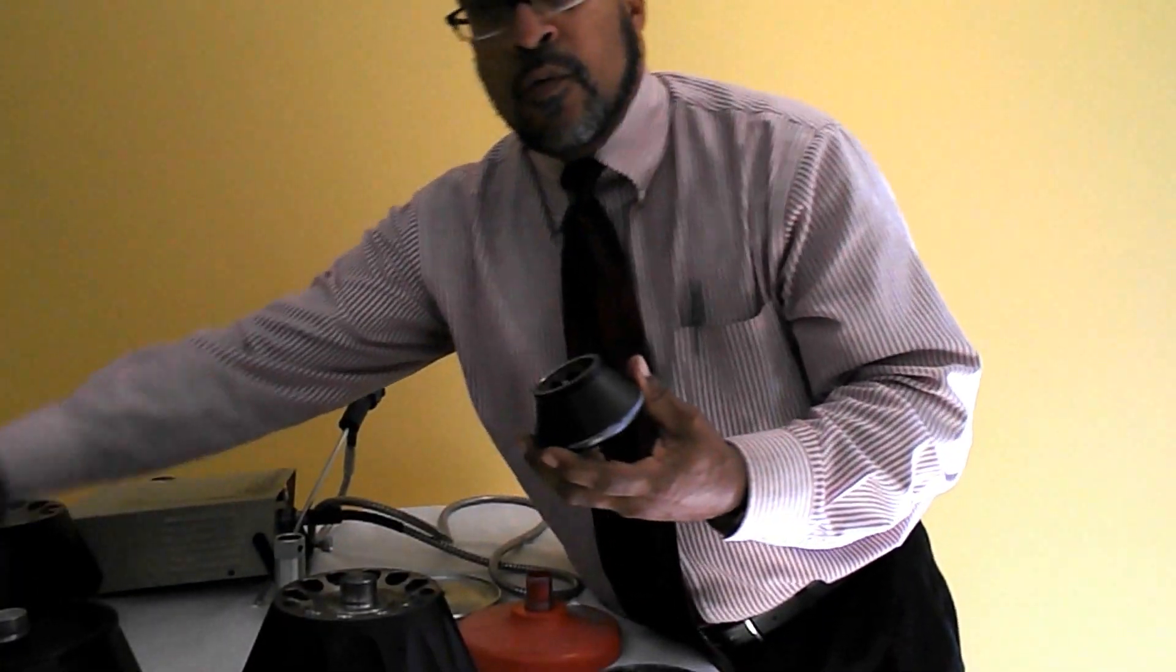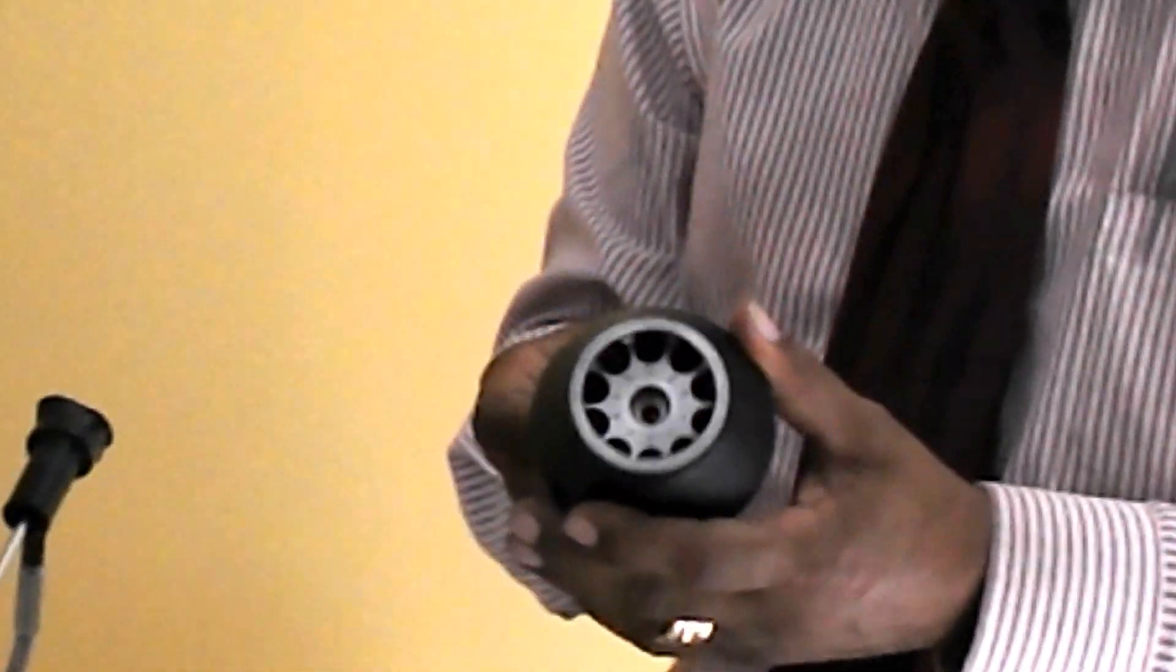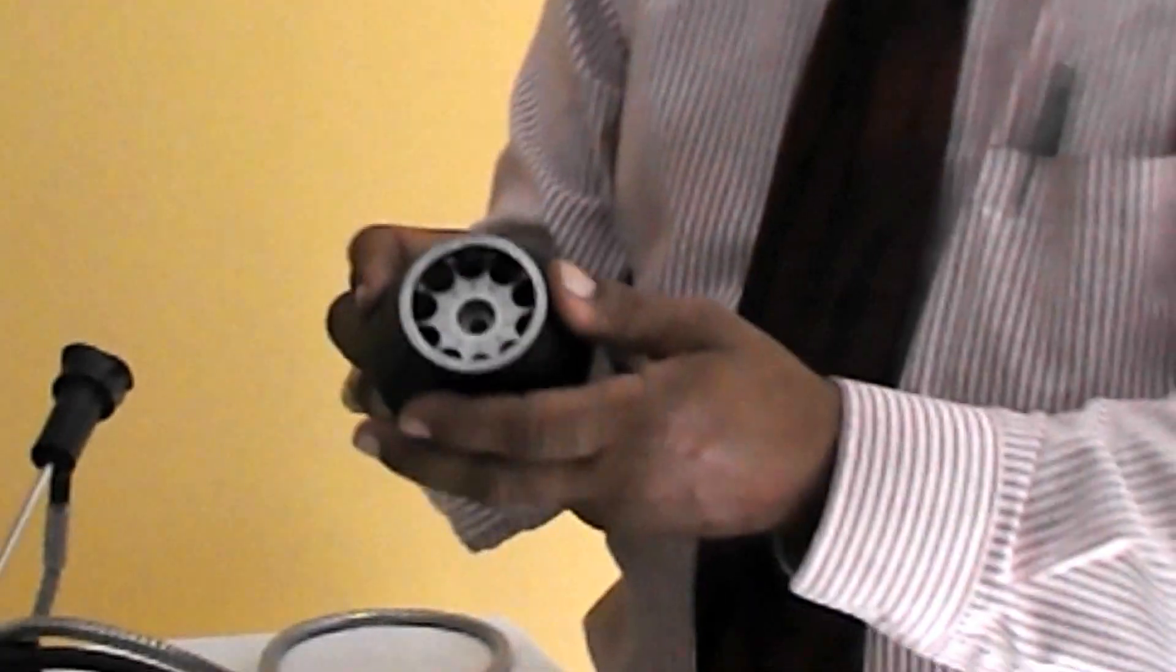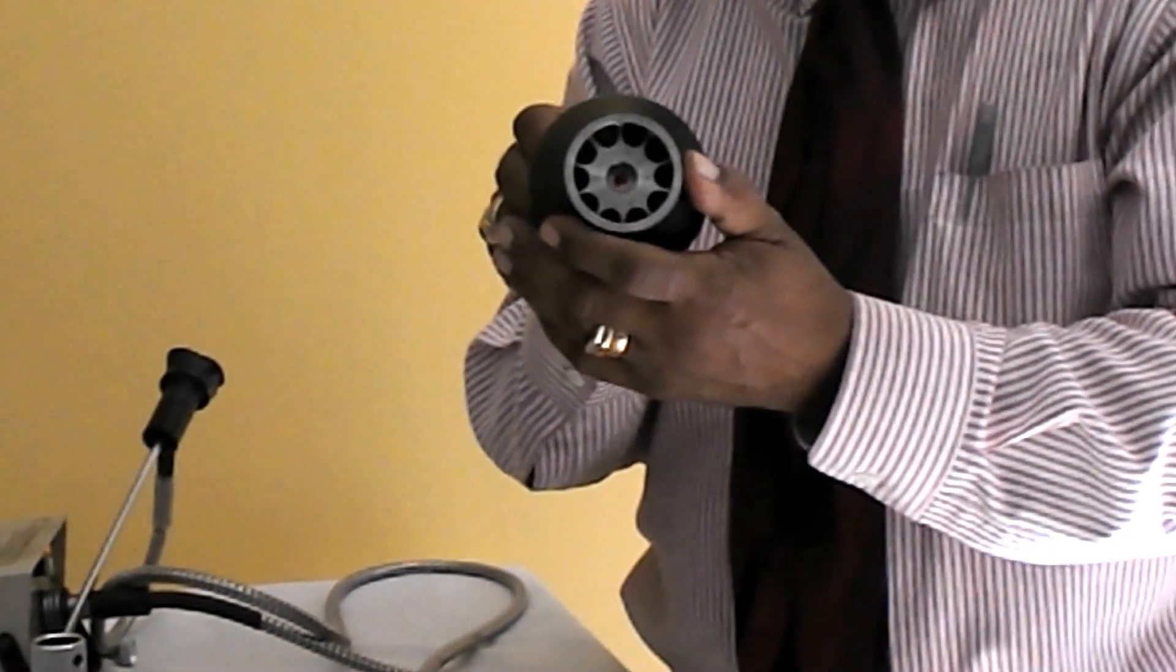We also have here a TL100 rotor, which is an ultra centrifuge. Very small. As you can see, this is a titanium rotor.